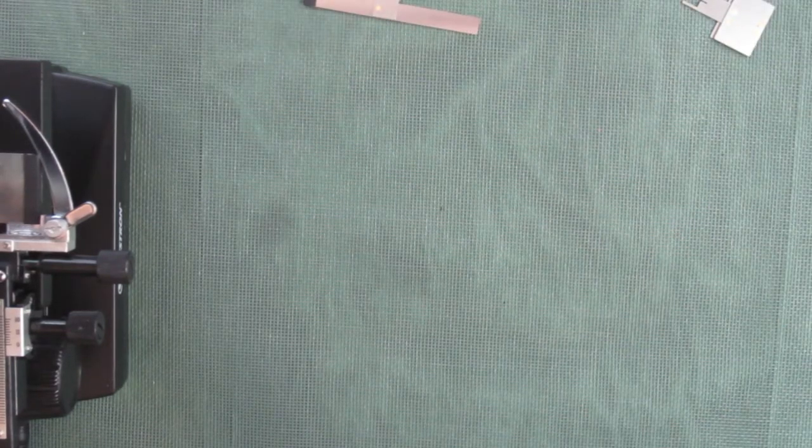Before I end the video, I'm going to take a cut on the sample with the new quick cross-section microscope slide.